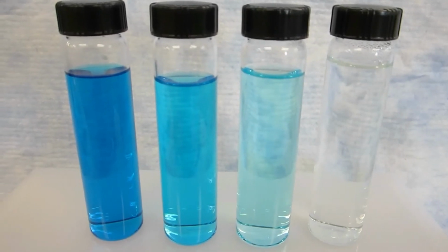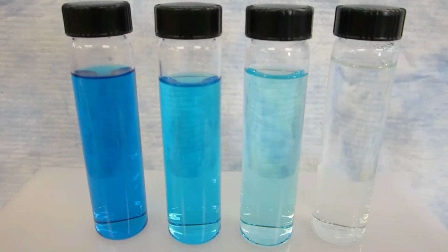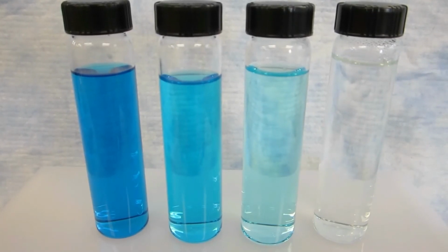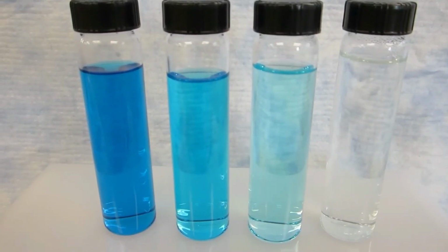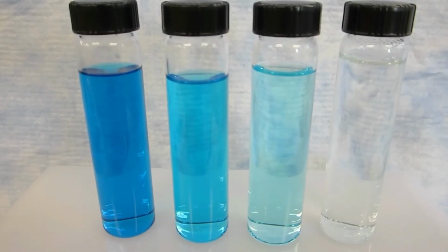The 3 properties that affect absorbance can easily be seen. Concentration and absorbance are directly related. As concentration increases, so does the absorbance. The solution on the left is highly concentrated, while the solution on the right has a concentration of 0.